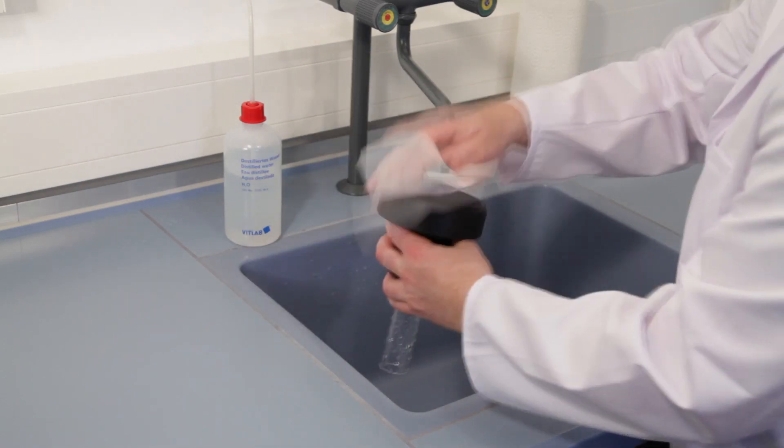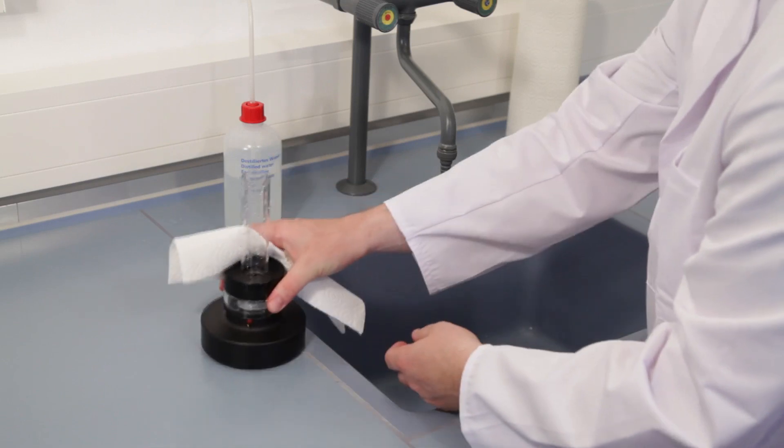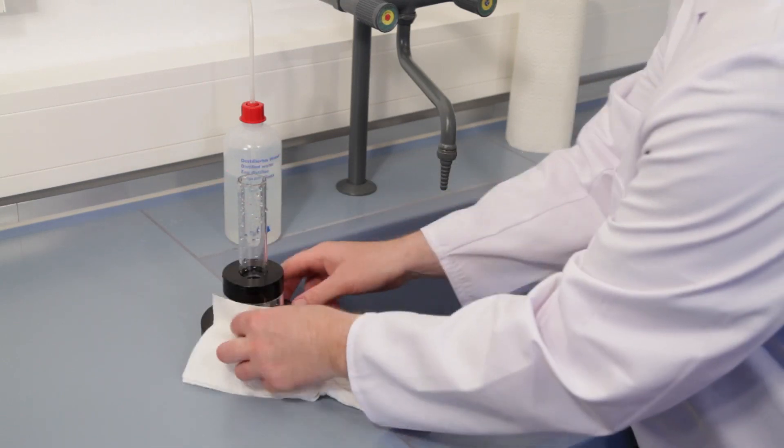Carefully dry the measuring cell with a towel, especially the electrode pins.